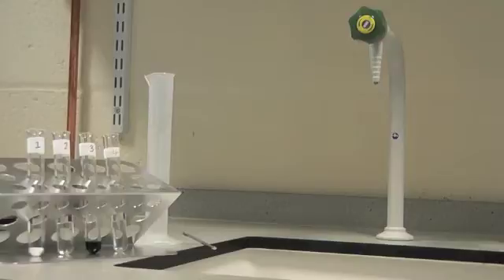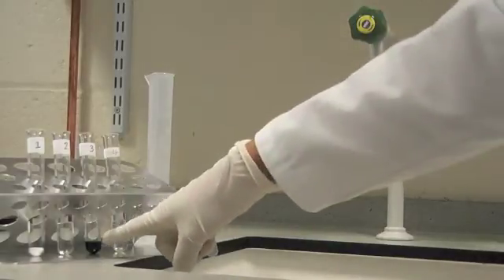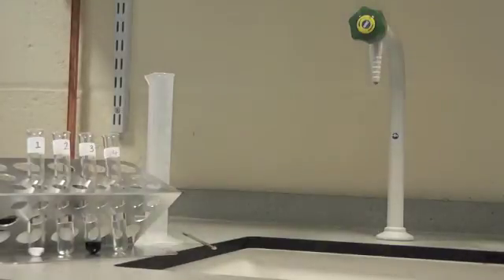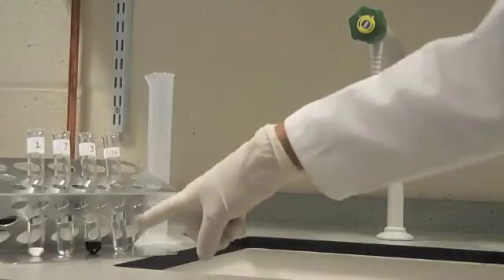Put one centimetre cubed of indicator into test tube three. Put five centimetre cubed of ethanoic acid into test tube four.